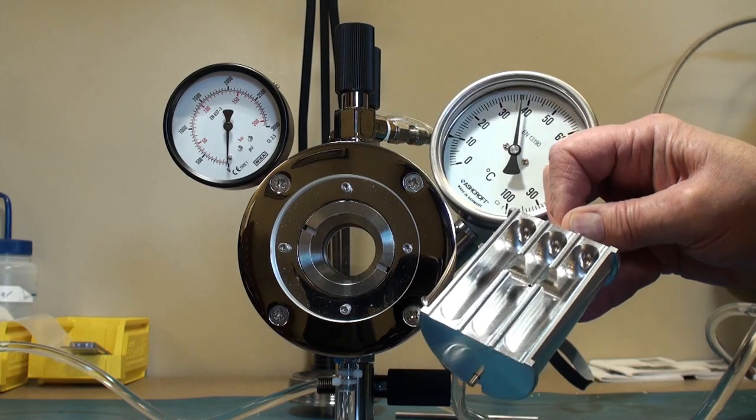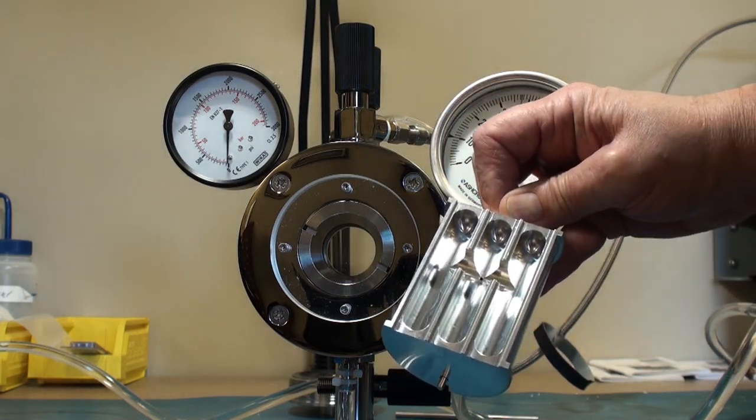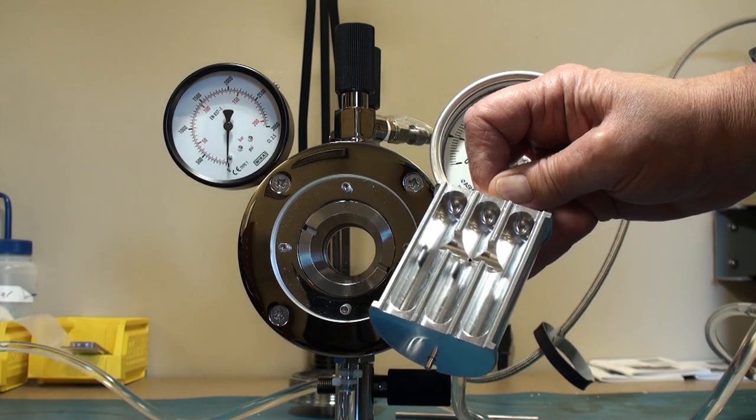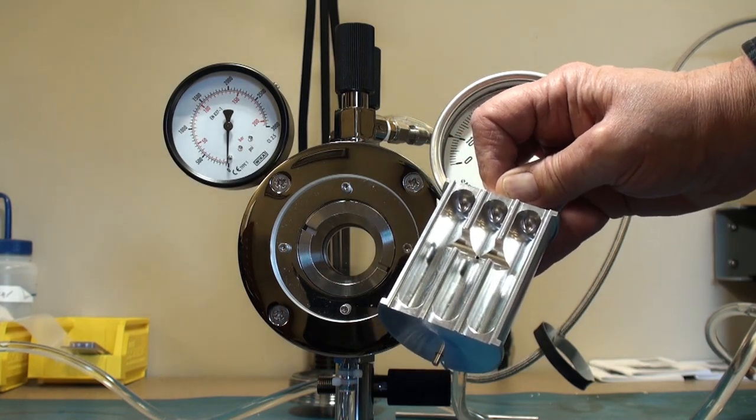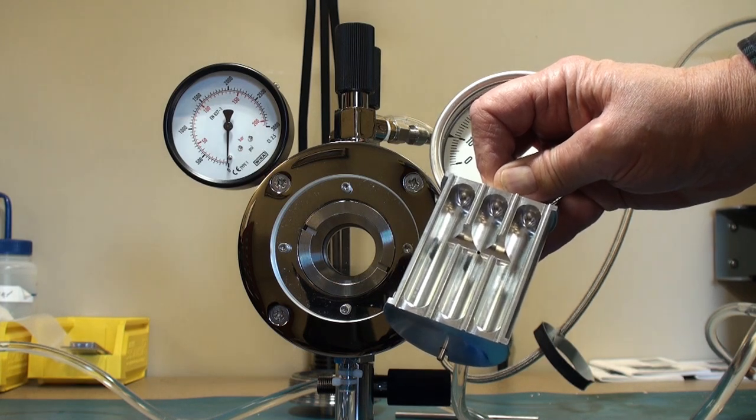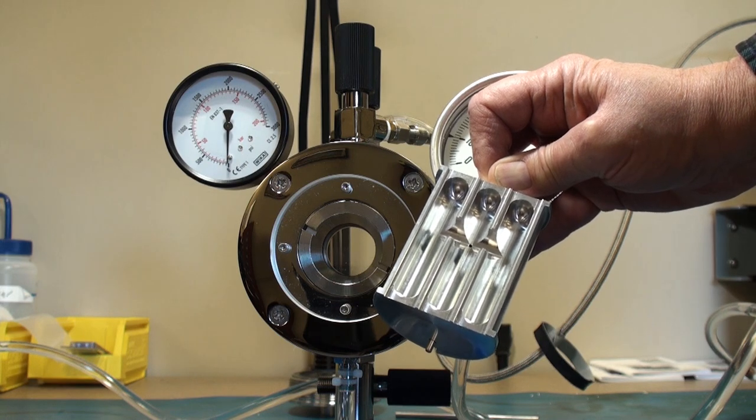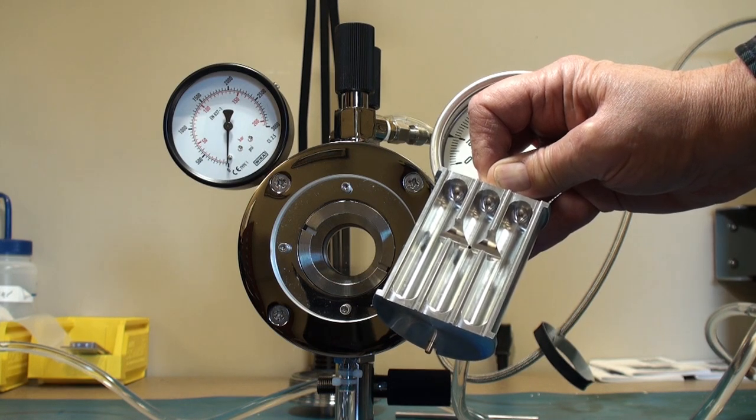So that concludes this video on how to set up and use the E3100 critical point dryer. My name is Al Koretz on the applications and service manager. My contact information will be at the conclusion of this video.